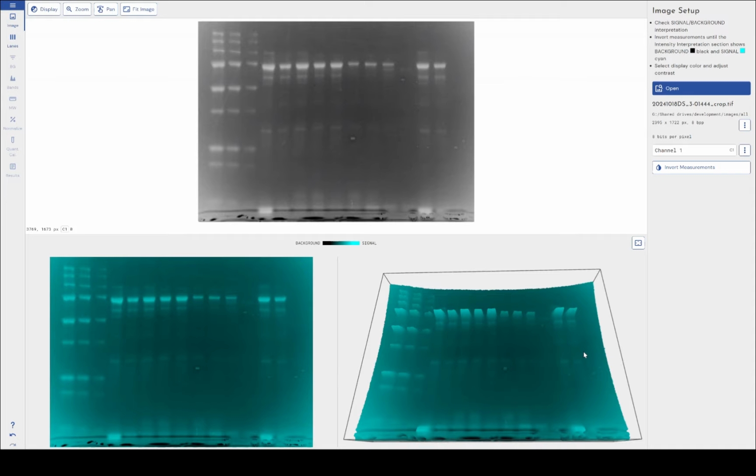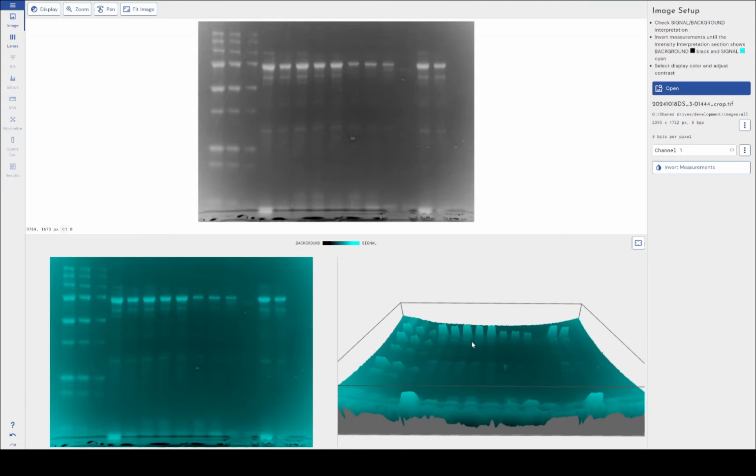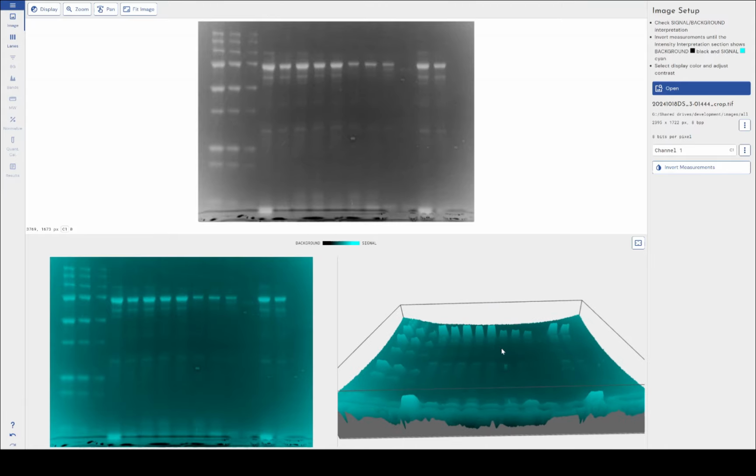Well, with the correct software, you can still get good quality data out of an image such as this. So that's where Phoretix 1D really shines. It can still get you good quality, quantifiable, reproducible data, even in less than perfect circumstances such as this. It can give you good output, even with poor input, is another way of saying it. So how am I going to possibly quantify these bands, given that this background is so variable across my image?